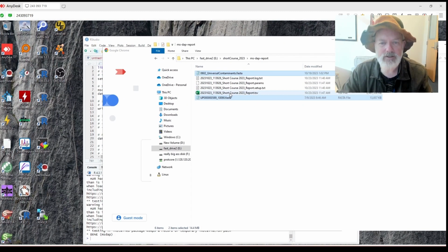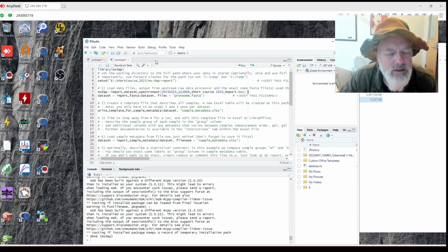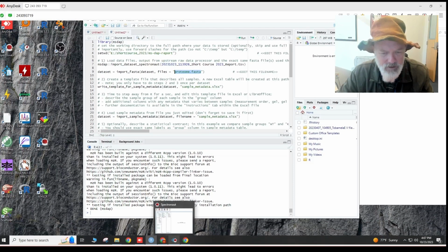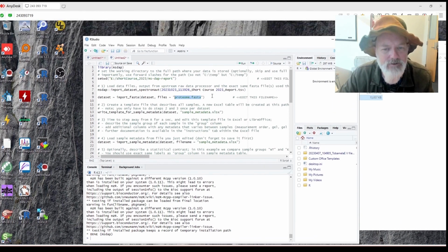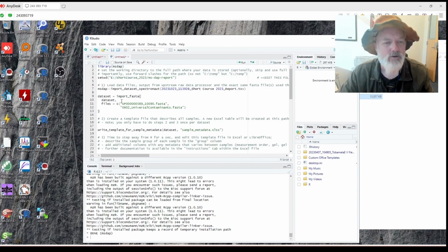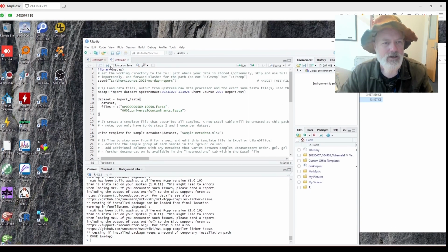All right. So here, set. And what we're going to do is, there's an easier way to do this, which I have it open on my other. Basically, you can put the little C. So what I like to do is, instead of that one, use, let's see, FASTA. So there is the C for concatenate, I think. So that'll let us do two FASTAs. So, all right, let's see if this worked.